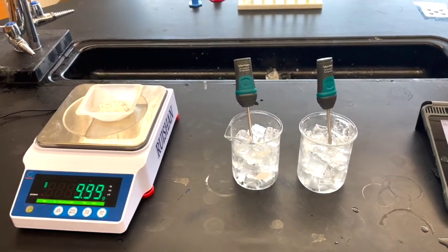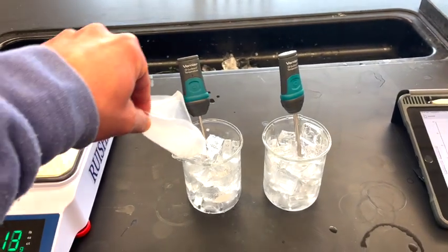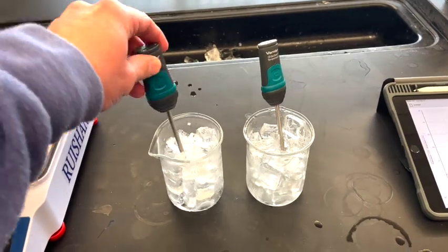Now I'm going to show you freezing point depression. What you have are two beakers of just ice. And in the left one, once again, I'm going to add 10 grams of salt. I'm going to mix in the salt, and then we'll monitor the temperature over time and see what happens.